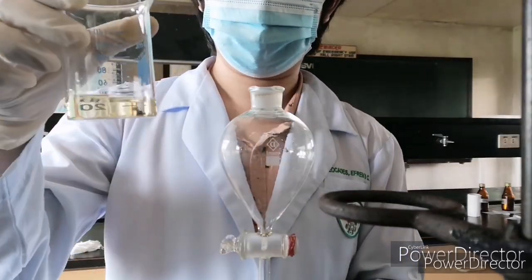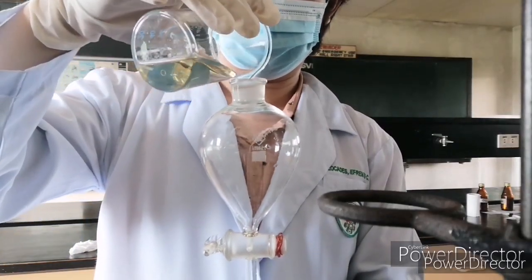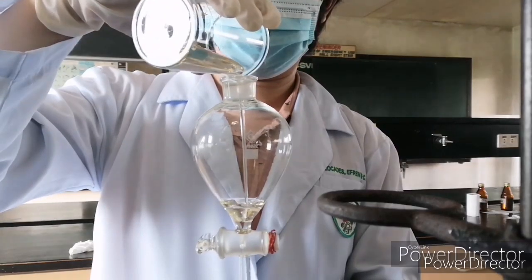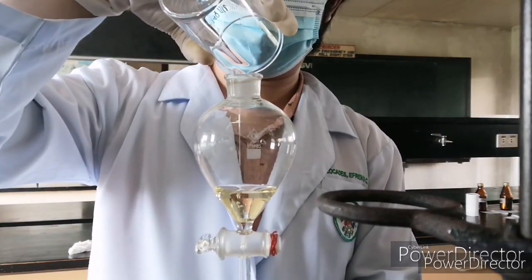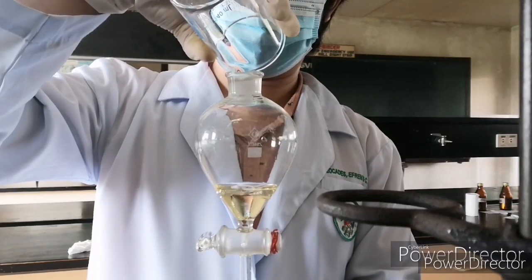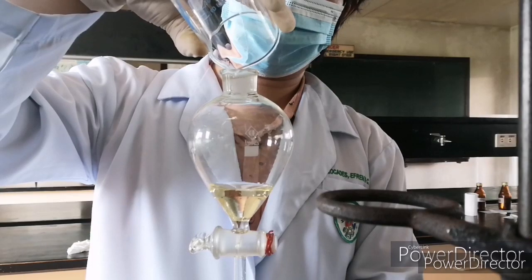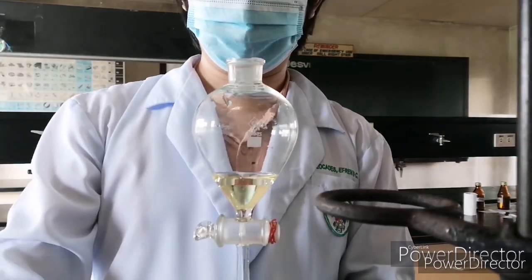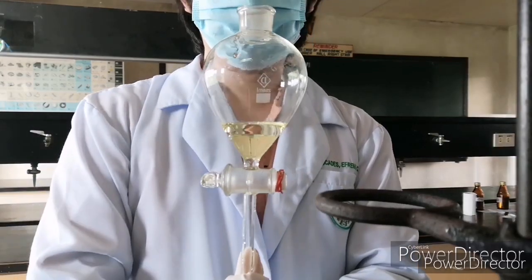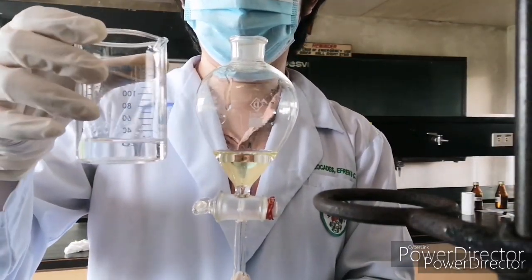And first, I am going to place your cooking oil, followed by your water.